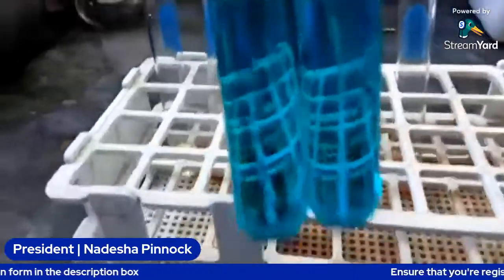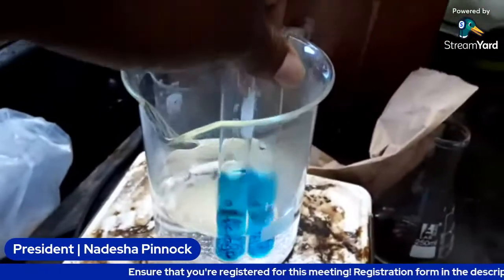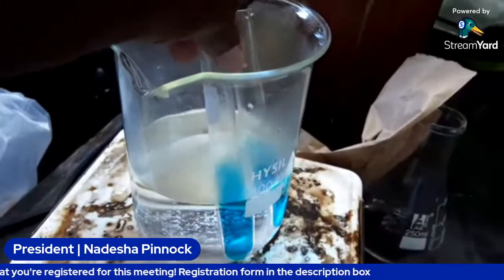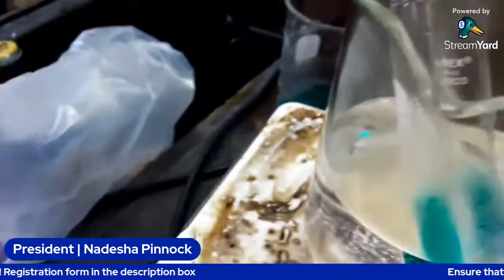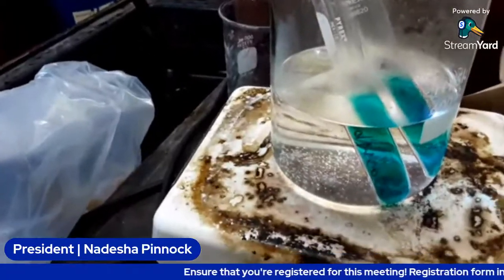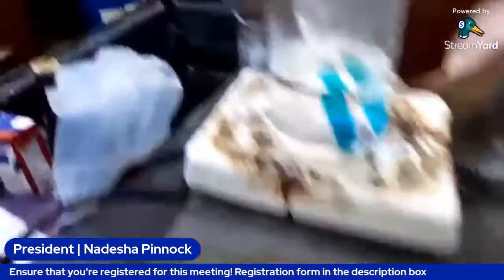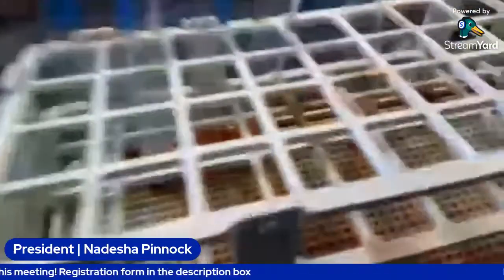So now we're going to add them to our water bath, which is basically water in a beaker. We're going to leave it for about 5 minutes. Should be 3 to 5 minutes. So we're going to leave it for about 5 minutes, and we're going to move on to our protein test.